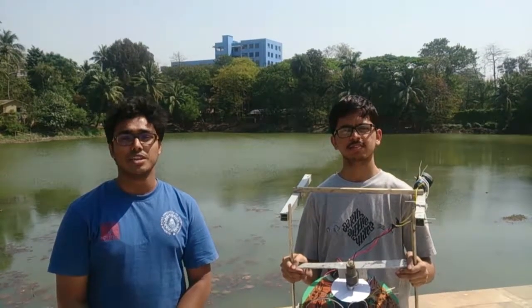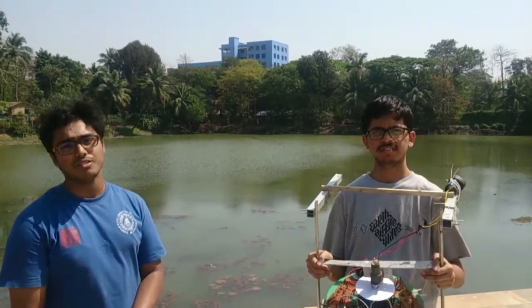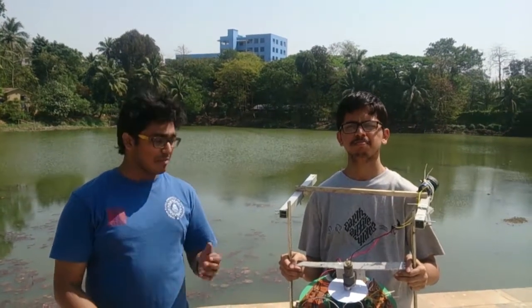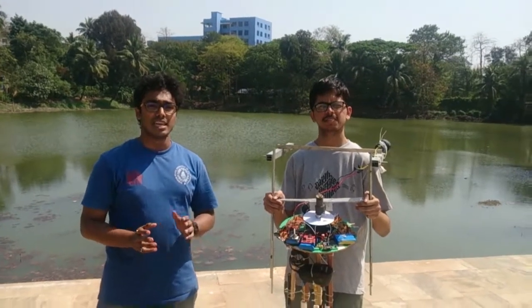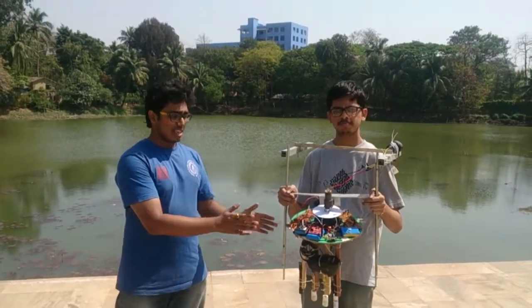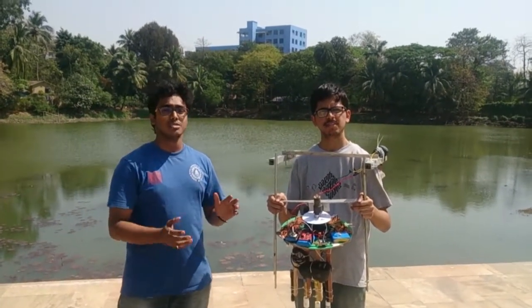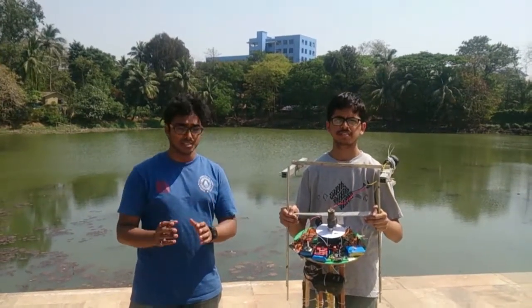We, the students of Sardar Patel Institute of Technology, are at the Bhavans Lake, which is a lake in our campus itself. For the problem stated earlier in the video, we have made a device named W.A.T.E.R, Water Analysis Testing Estimation Remotely. This device consists of two parts. One is the transmitting device, as you can see here, and one is a receiving device which can be placed at a receiving station, which is basically a graphical user interface.